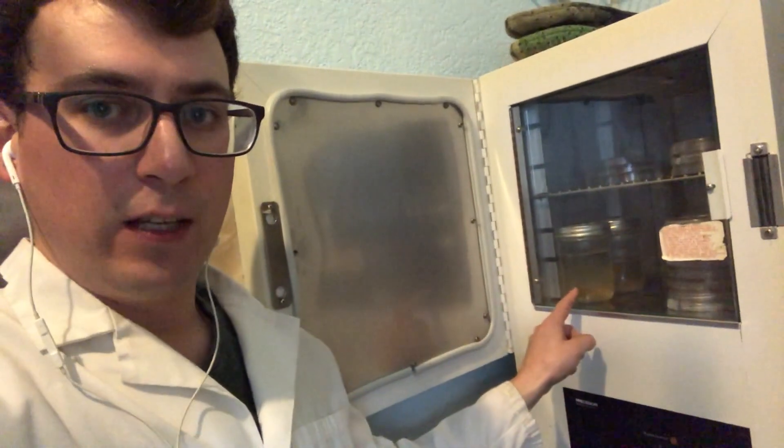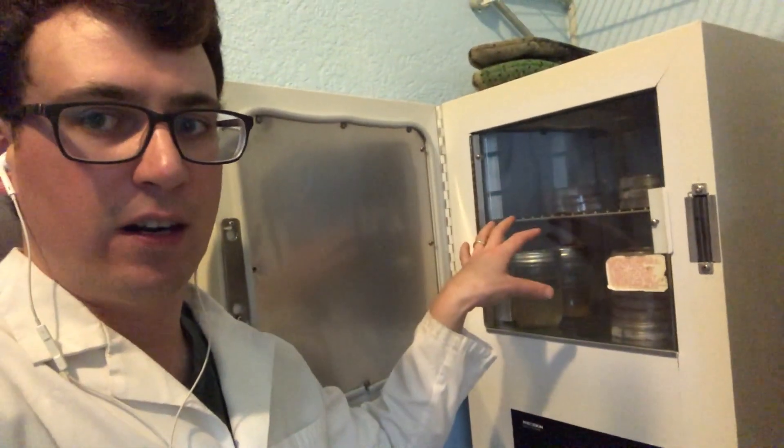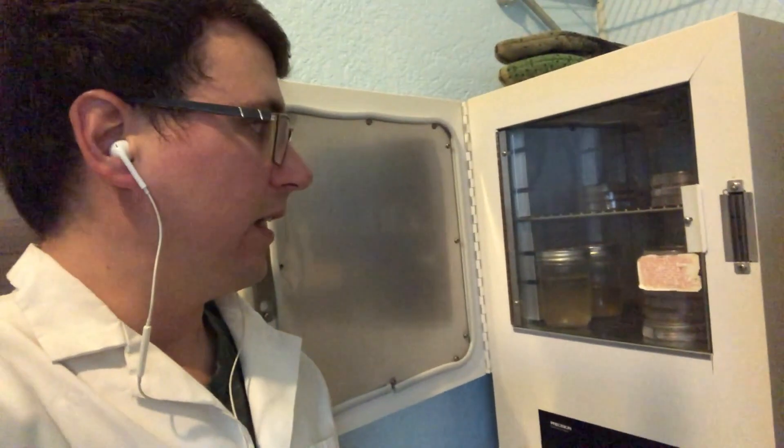So then I'll open this up and you can see it has a nice rubber gasket which helps keep the temperature very stable. And then it has this glass viewing window. So if you're growing out liquid cultures like these, you don't actually have to open it completely. And that way it keeps the inside of your incubator nice and clean.